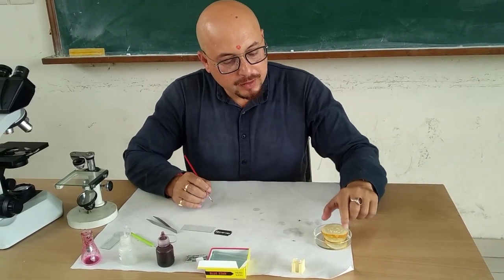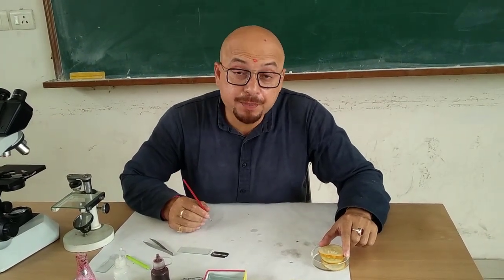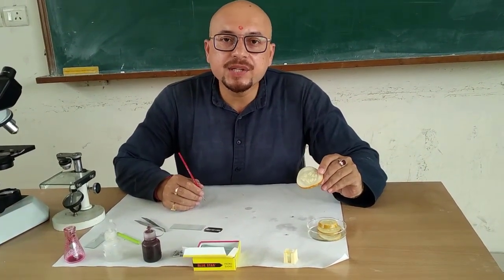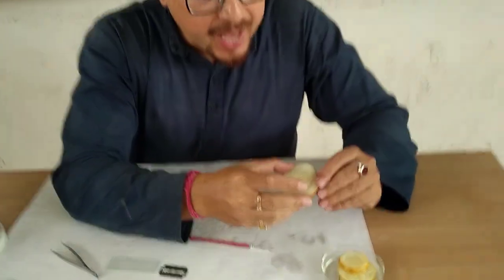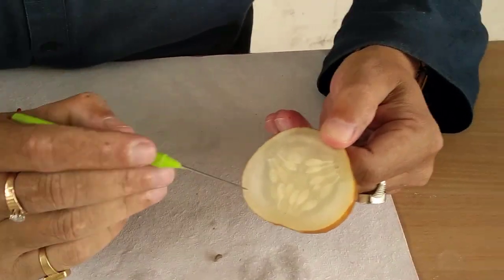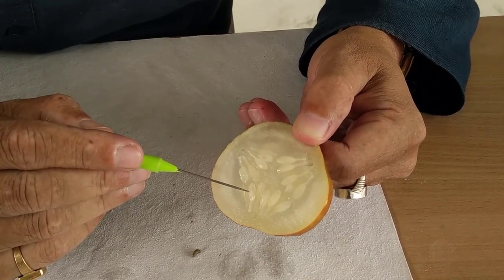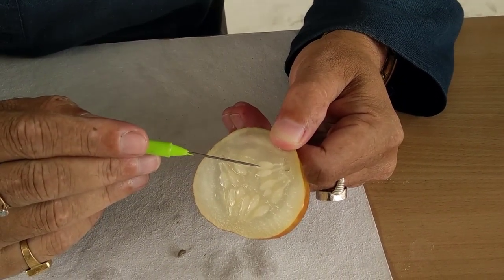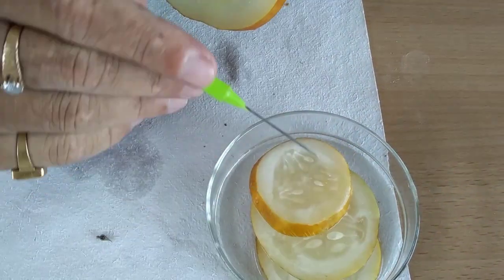Dear children, now I'm going to show you how to take out the endosperm. I have with me the seeds of cucumber — kheera. Please come close and you can see the seed texture. Now if I take this particular seed, it is quite translucent. Avoid translucent seeds. Those seeds which are comparatively opaque, you take them — like this one, this one, this one.